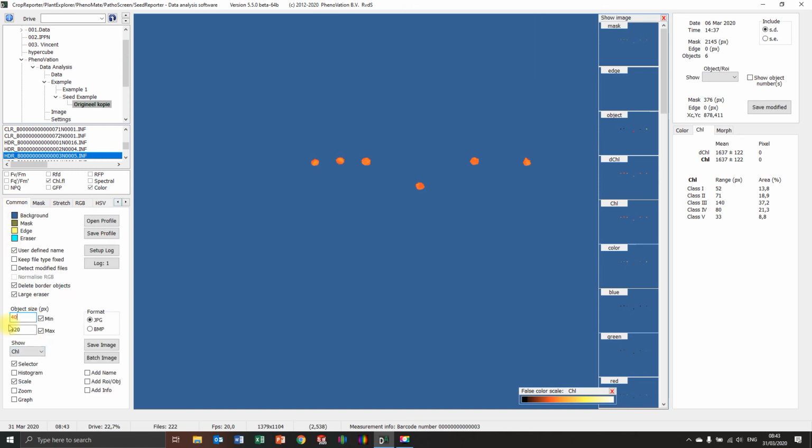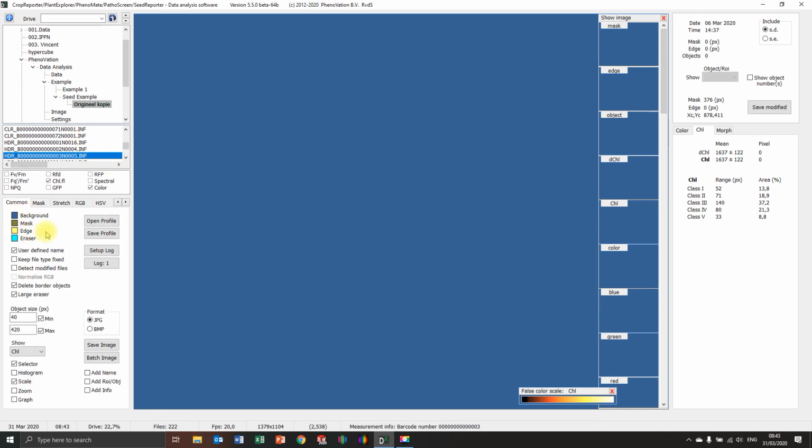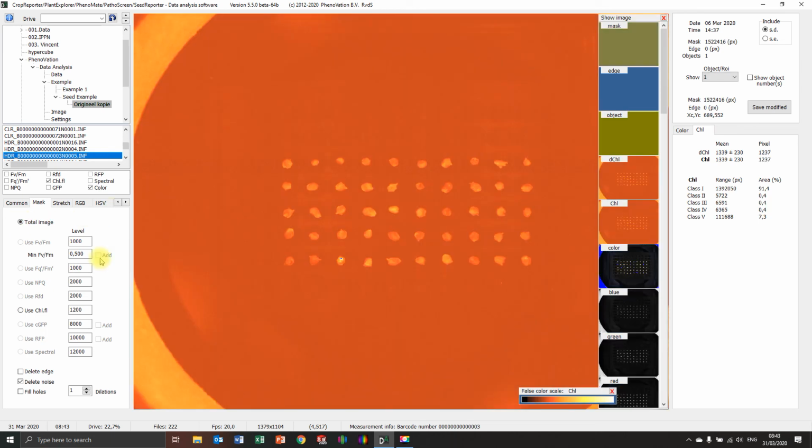40. No, that's not the case. Then the fluorescence is too tight, maybe. Oh, it's even gone. So now you have another thing. But what you also noticed, this is a different batch of seeds. These are not the small seeds. So my client put all the seeds of different seed lots, like I think brassica and pepper seeds, in one file. But you cannot analyze both in the same setting because they have different characteristics about the level.